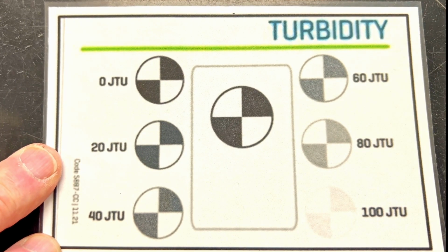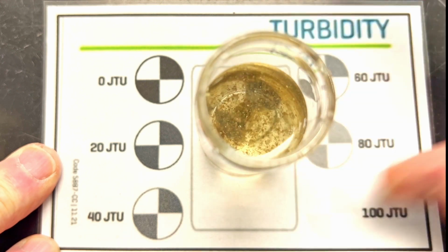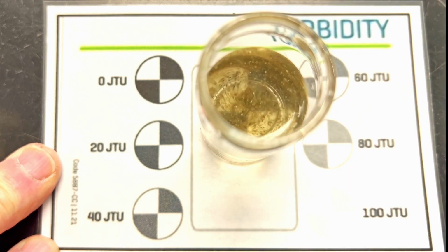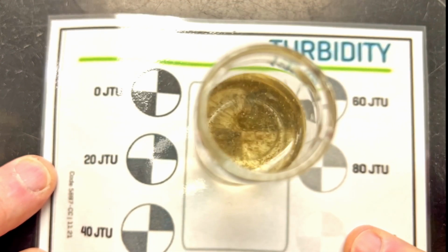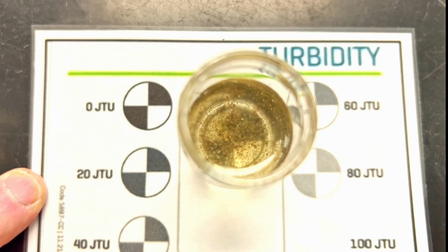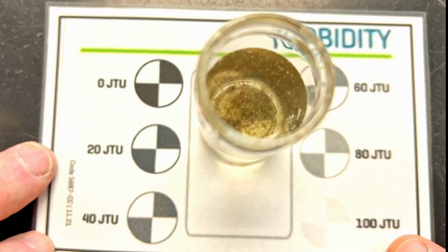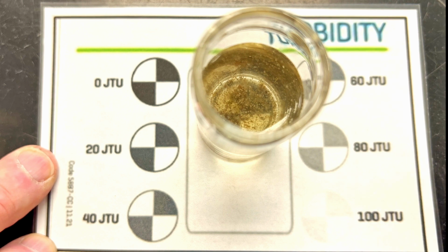And here we're going to go with sample B. I'm trying to make sure we get it lined up. You're trying to look through, and see what the grid most closely resembles. And try and get it out here so we can see all of the units.